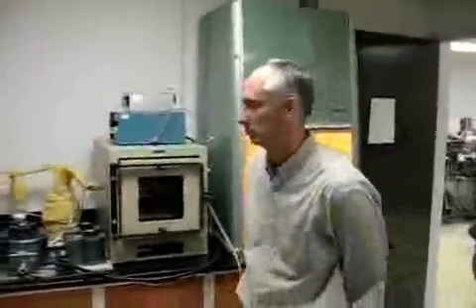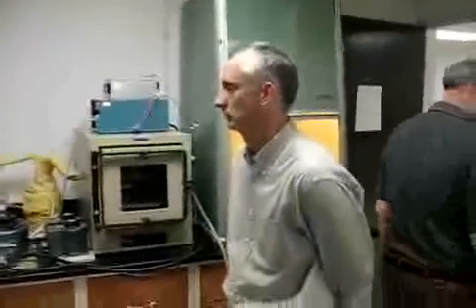23rd of April 2010. We're at Huffman Labs, and we're going to have Mr. Huffman here walk us through the environmental chamber. Go ahead, sir.